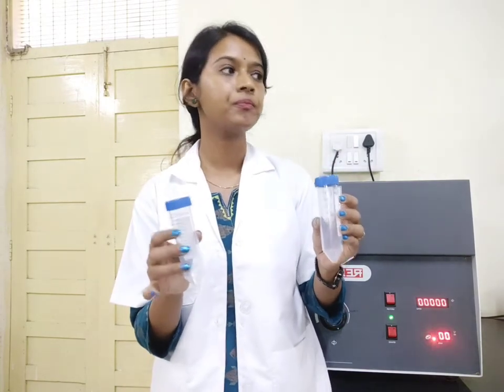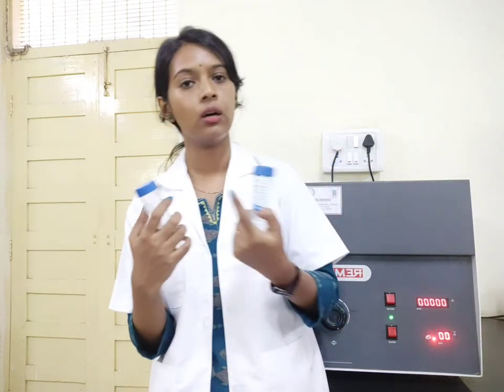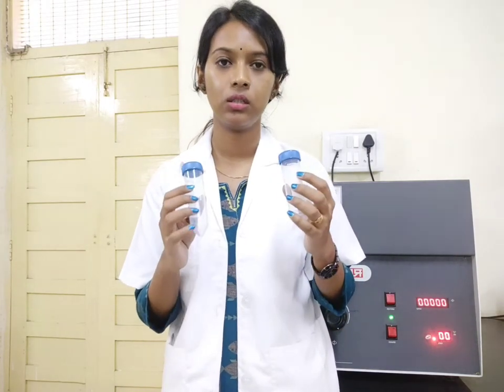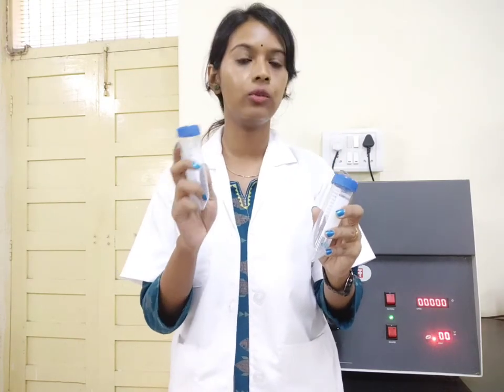If the instrument is not balanced, when your sample rotates at very high speed the rotor will not rotate in a uniform pattern. If one side weighs more, the centrifugation will not be proper, and more importantly, your instrument will get damaged very quickly. That is why you must make sure that whenever you keep sample inside, it is in a balanced condition — if you have only one tube of sample, take another tube with blank and you can still run the instrument.